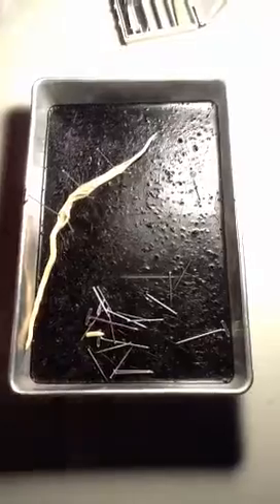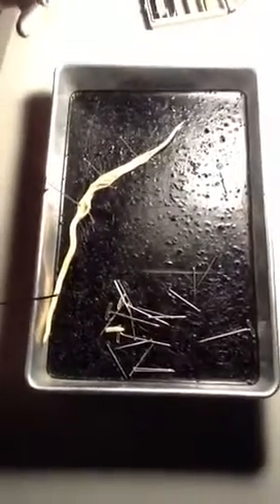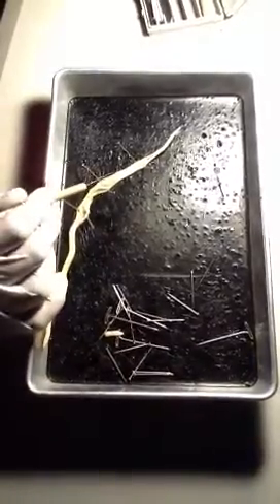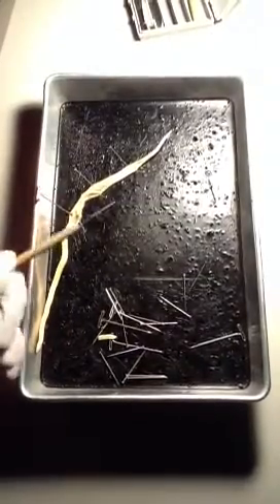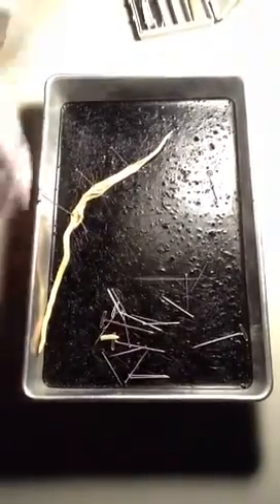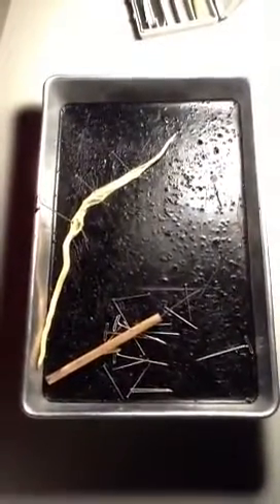The intestine is where the food is absorbed — there's no circulatory system, so basically it's absorbed and then it just kind of diffuses to the cells as they're needed. The vagina is where the eggs are released and the sperm enters. The uterus is where they're fertilized. The ovaries make the eggs. The oviducts carry them from the ovaries down to the uterus. Does that make sense to everybody? And then you also have the mouth and the anus — and that, ladies and gentlemen, would be that.